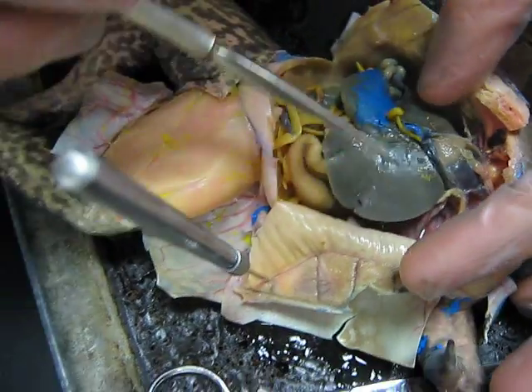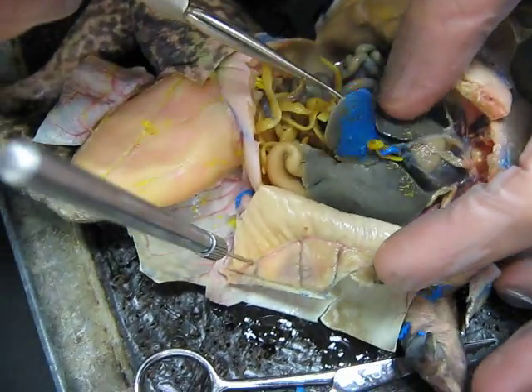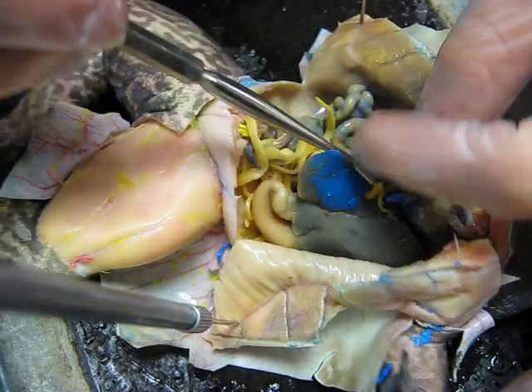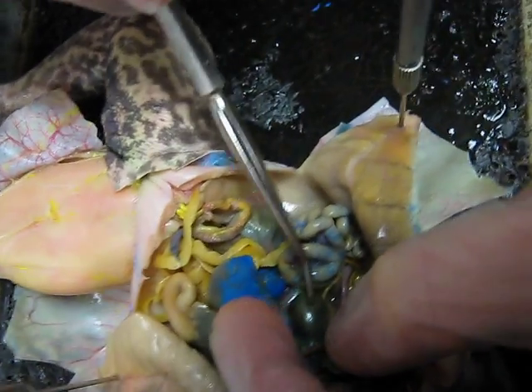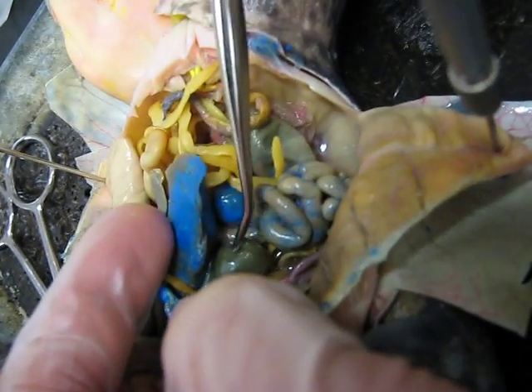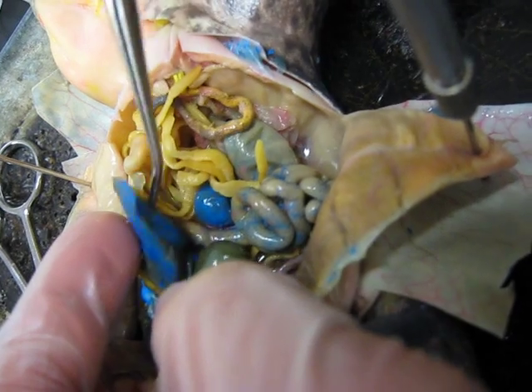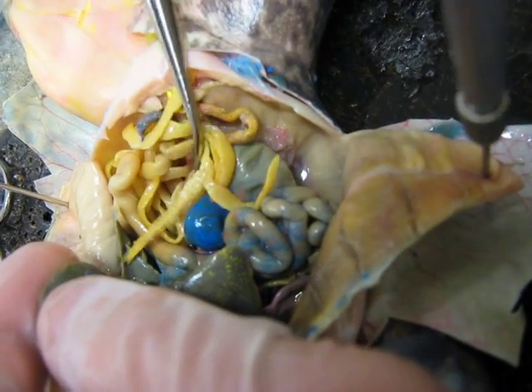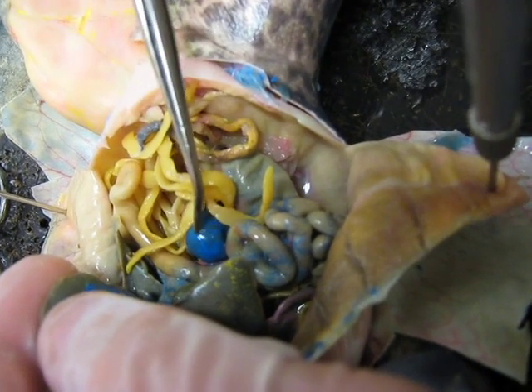Then we have the liver, and under the liver, in this balloon, bean-looking structure, is the gallbladder. And this circle is the spleen.